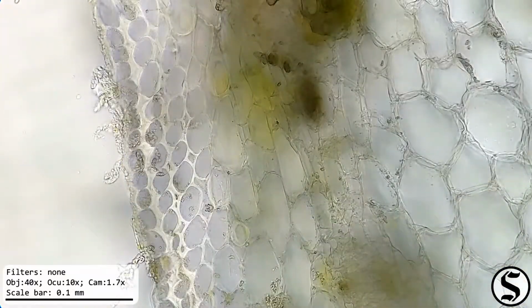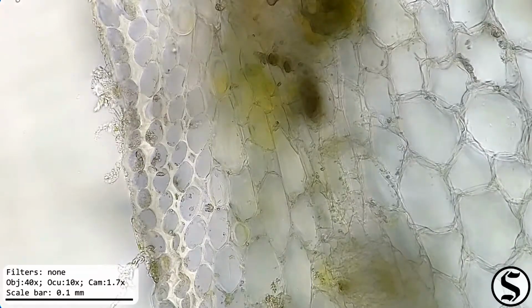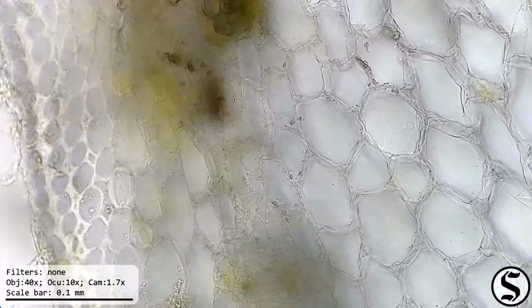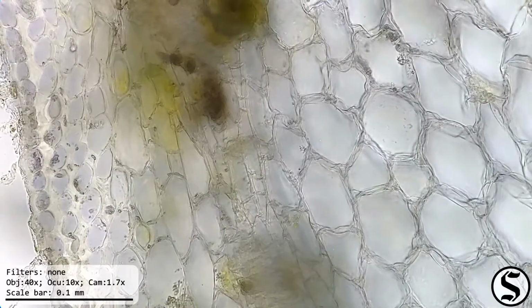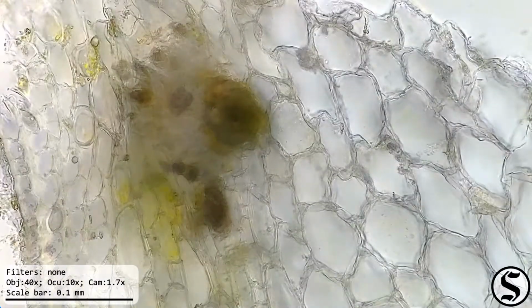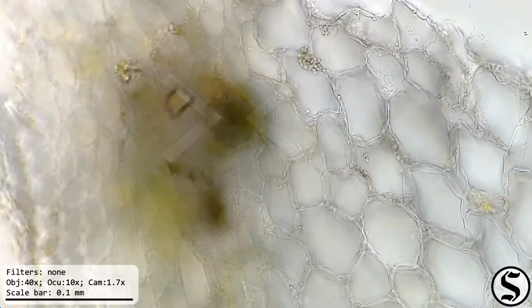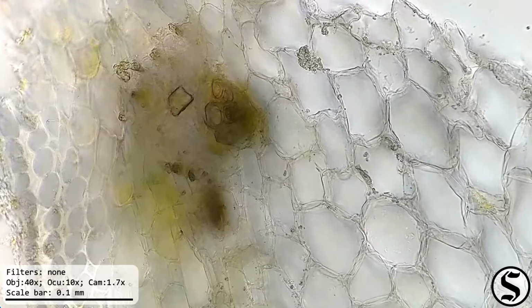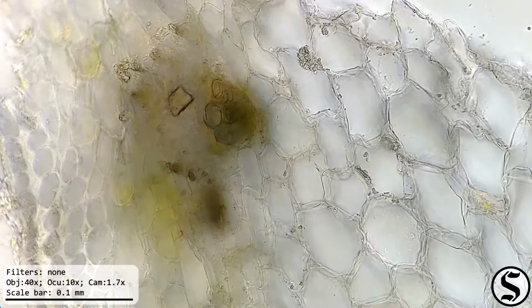Those cells look really interesting. I'm not exactly sure what the technical terms are for each of the layers here in the dandelion pedicel. It's kind of an odd plant structure, because the pedicel is basically like a balloon or a hollow tube. Oh, check out those tracheids there in that vascular tissue. Those look neat. Well, anyhow, like I was saying, I may not know the precise terms for each of these layers, but they're still really interesting to look at.